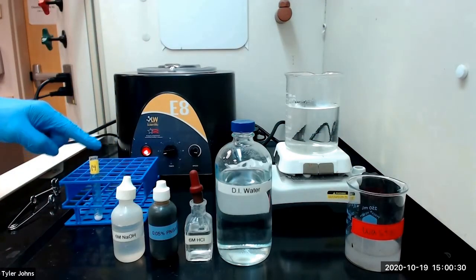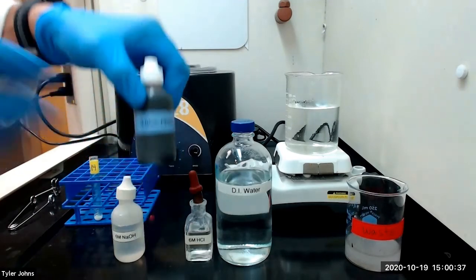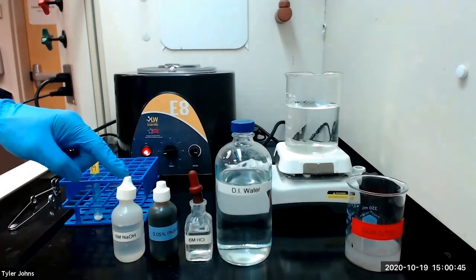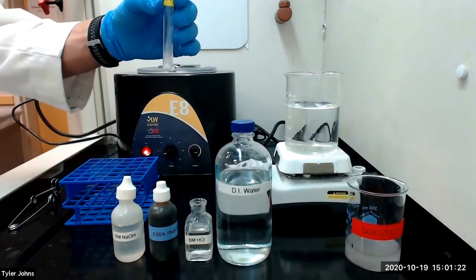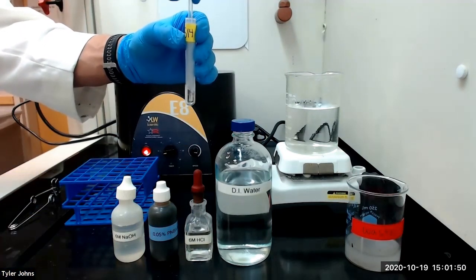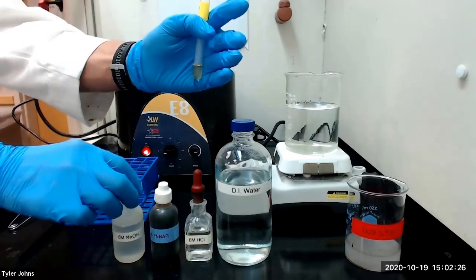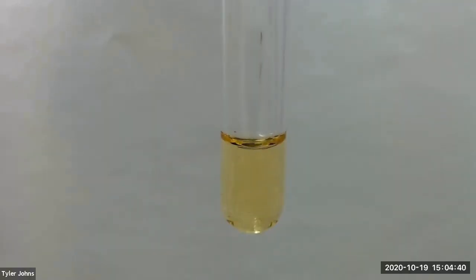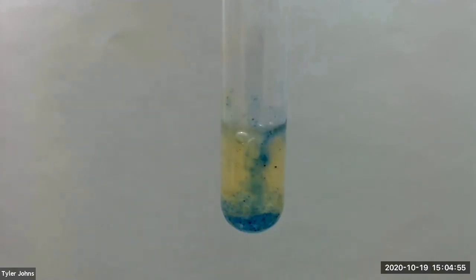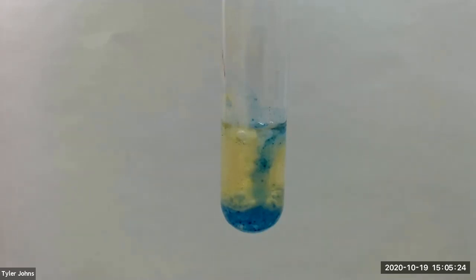We will next dissolve our precipitate by adding several drops of six molar hydrochloric acid and one milliliter of deionized water. We will then add one drop of magnesium reagent. We will then make the solution alkaline with the addition of six molar sodium hydroxide. The blue flocculant confirms the presence of magnesium ion.